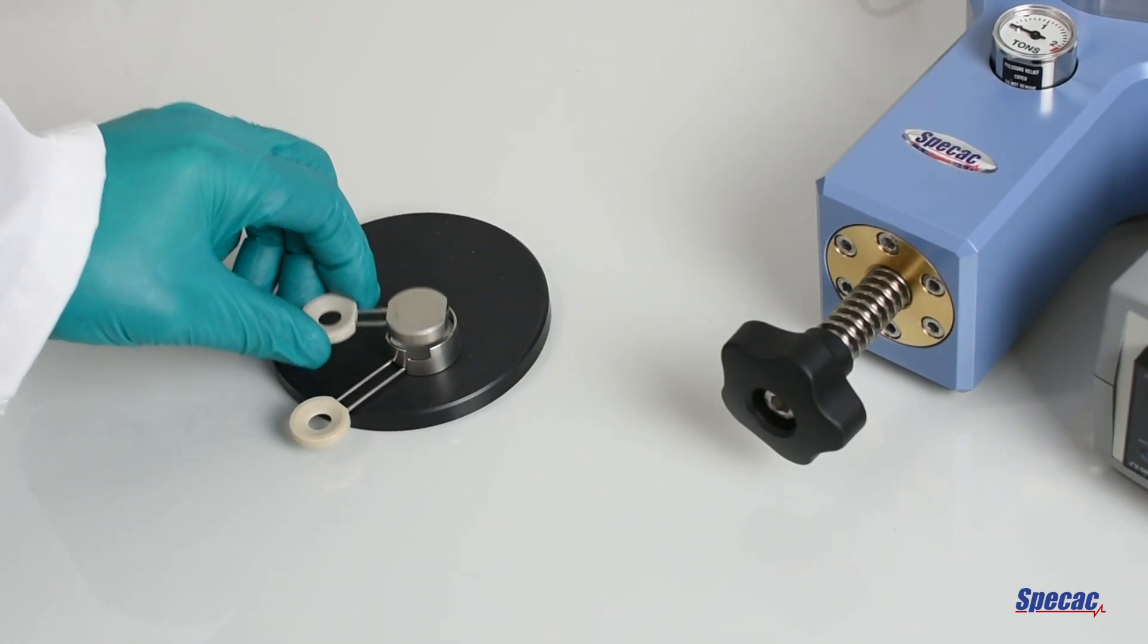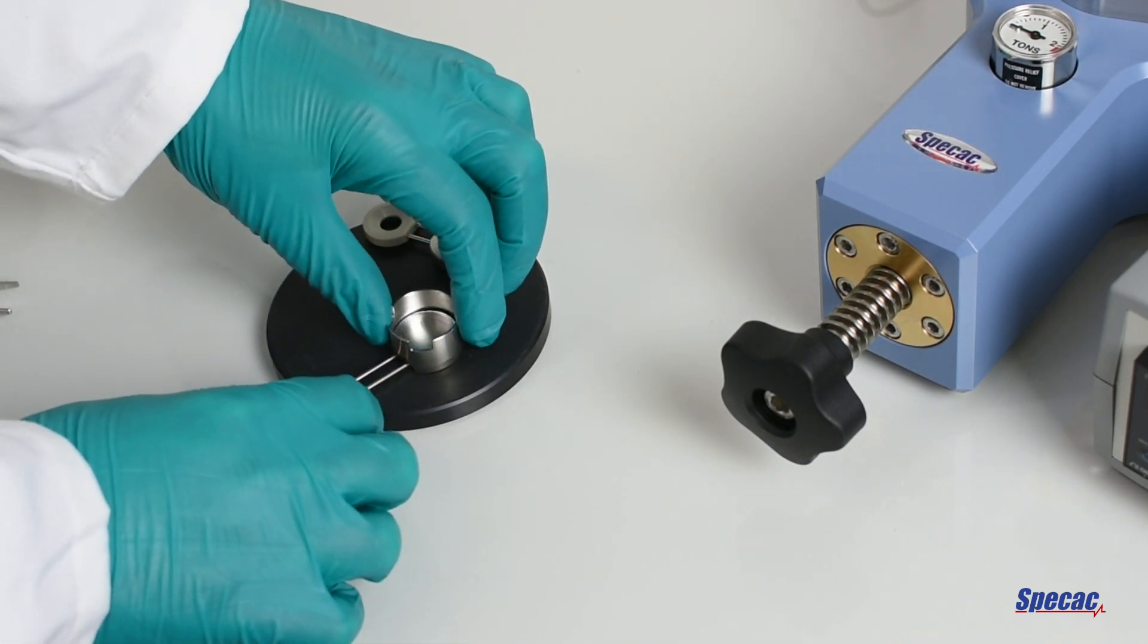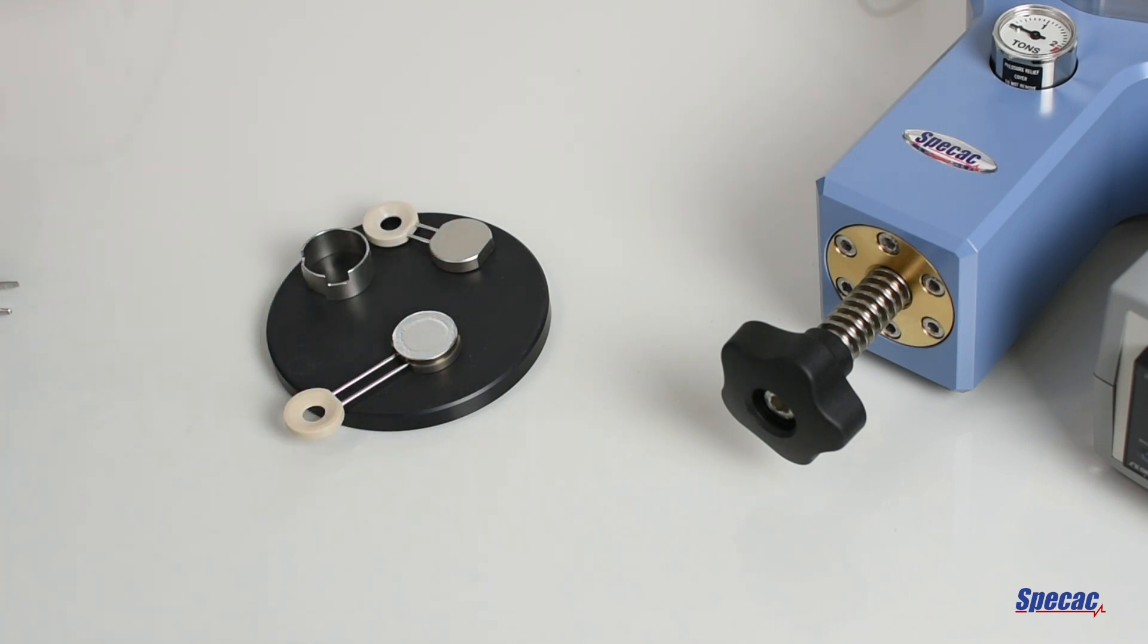It is possible, while the film maker assembly is still hot, to gently separate the components using tweezers. The film will be sandwiched between the aluminium foils placed earlier.